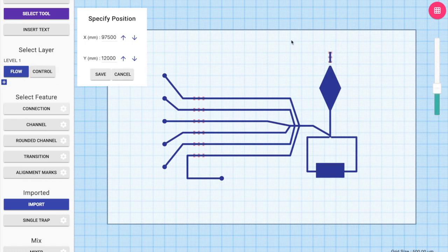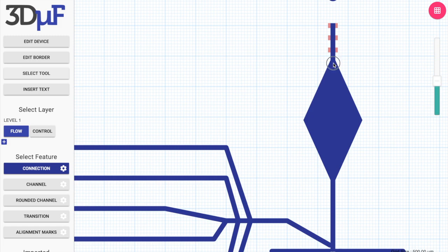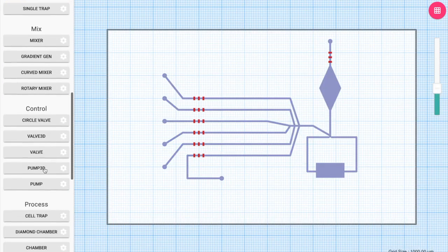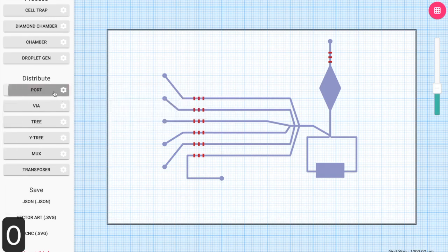So I moved the component closer by hitting the move tool. Then I copy the port component so I can generate another port with the same properties. Now that I finished the flow layer, I switch on to the control layer, where I will create the ports and connect all the pumps and create valves for the rest of this device. So first, I'm going to create the ports required for the pumps. I place them nicely, evenly spaced.